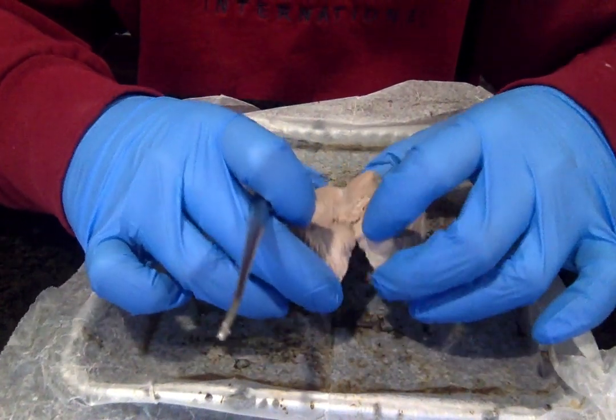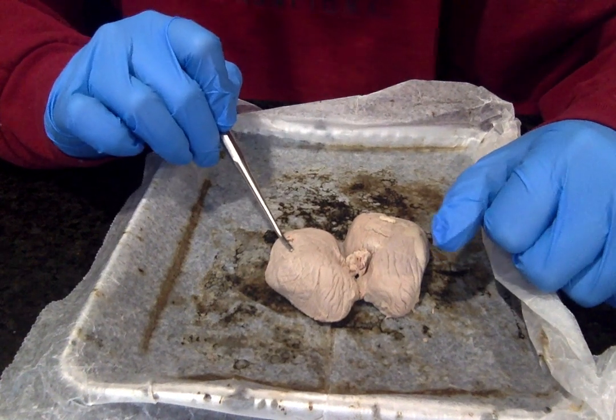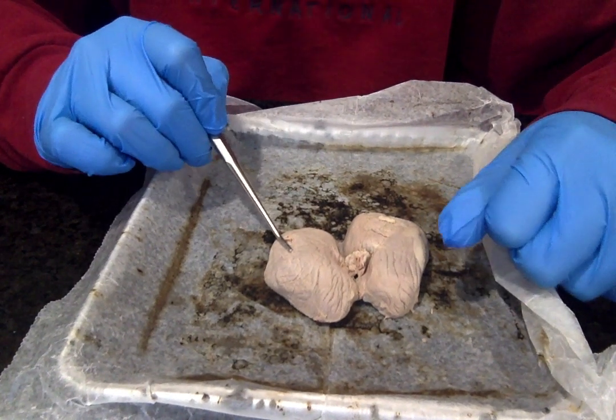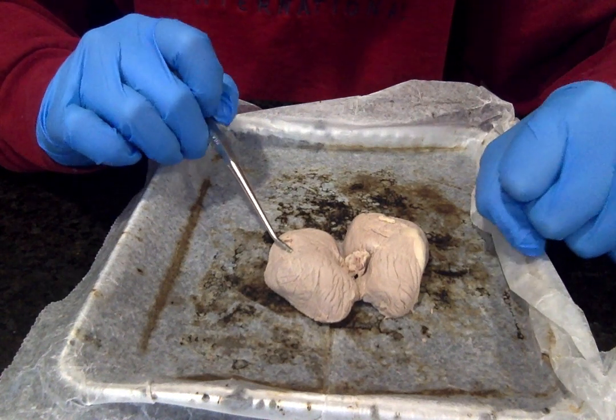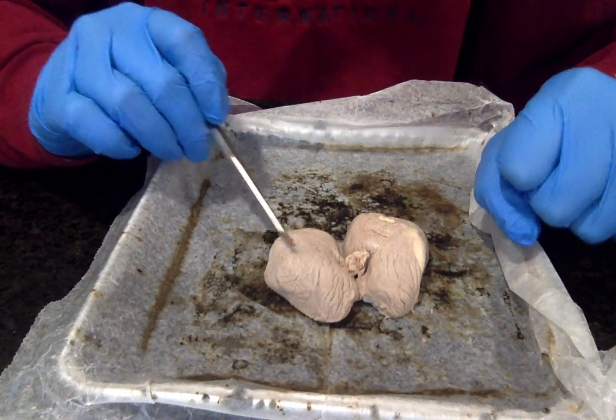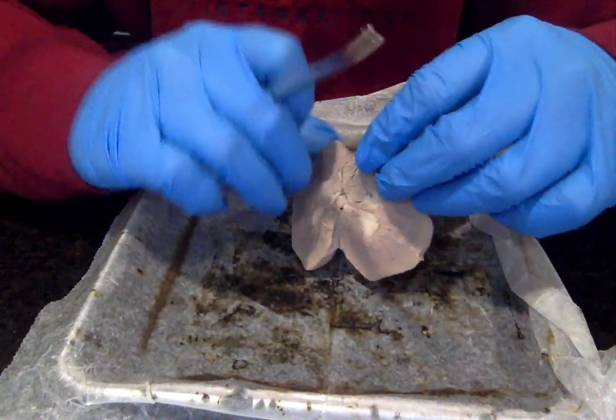So then the other two external features are the kidney lobes. It's two of them, a right and a left. It consists of a pyramid, which is a portion of the cortex at the pyramid base and a portion of the adjacent renal column. I'll talk more about the pyramids when we actually get inside it, but just note that there are two lobes, a right and a left.